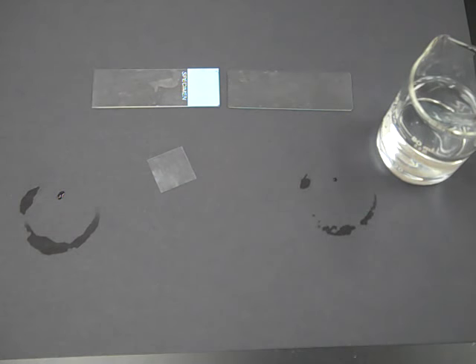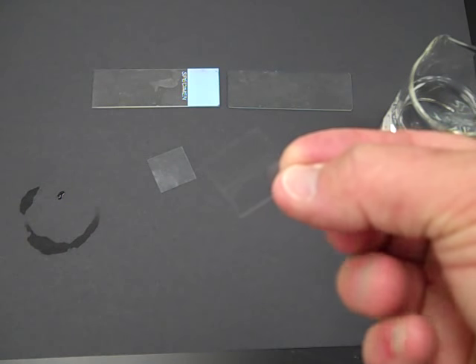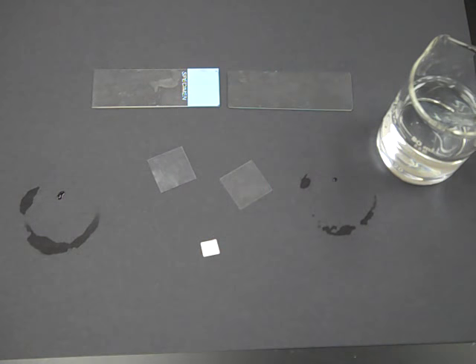The small piece here—it's hard to see as clear as it is—these are your cover slips. I'm going to use this white piece of paper as my object to demonstrate how to prepare a slide for what you're doing.